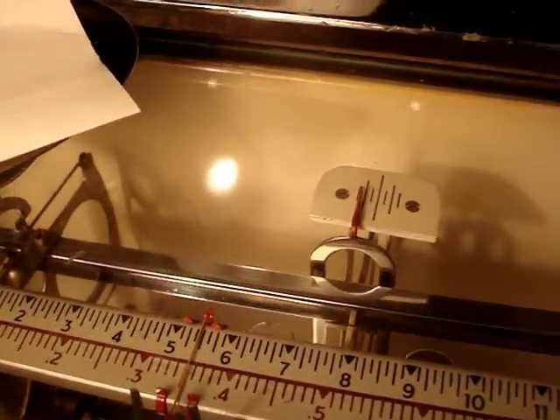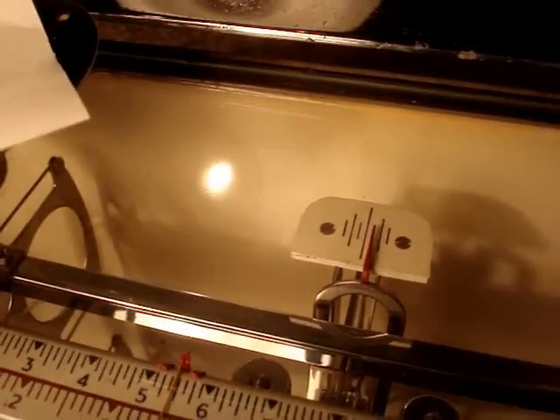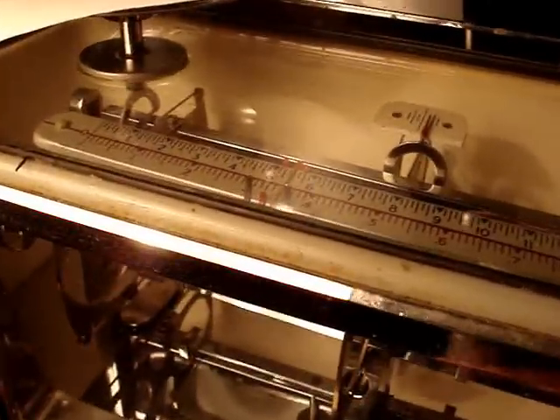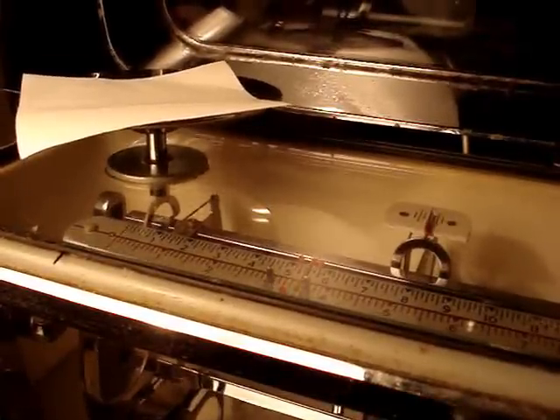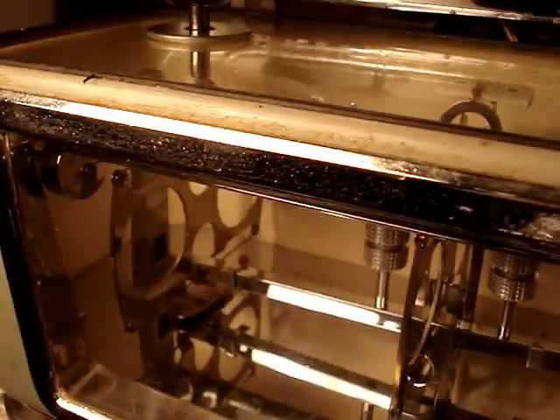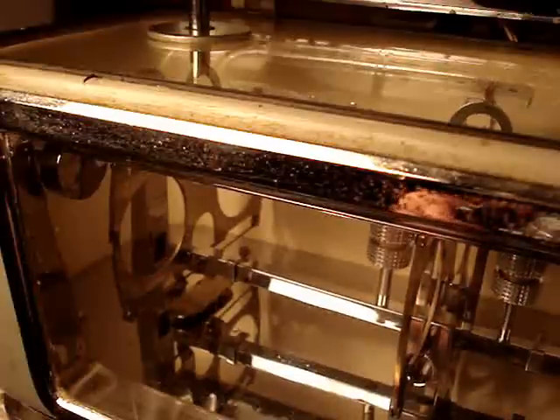That fork hooks onto it and moves the sliding weight. It's a torsion balance, you know. The hair beams — maybe you can see the hair beam right down the center there, parallel with the needle. It's visible on both sides. All six of them are in there and they're all intact — believe it or not, this is an old scale, but none of them are broken. These are the type of scales we like to use because this is a good thing for weighing things. It's been scientifically proven over the years.